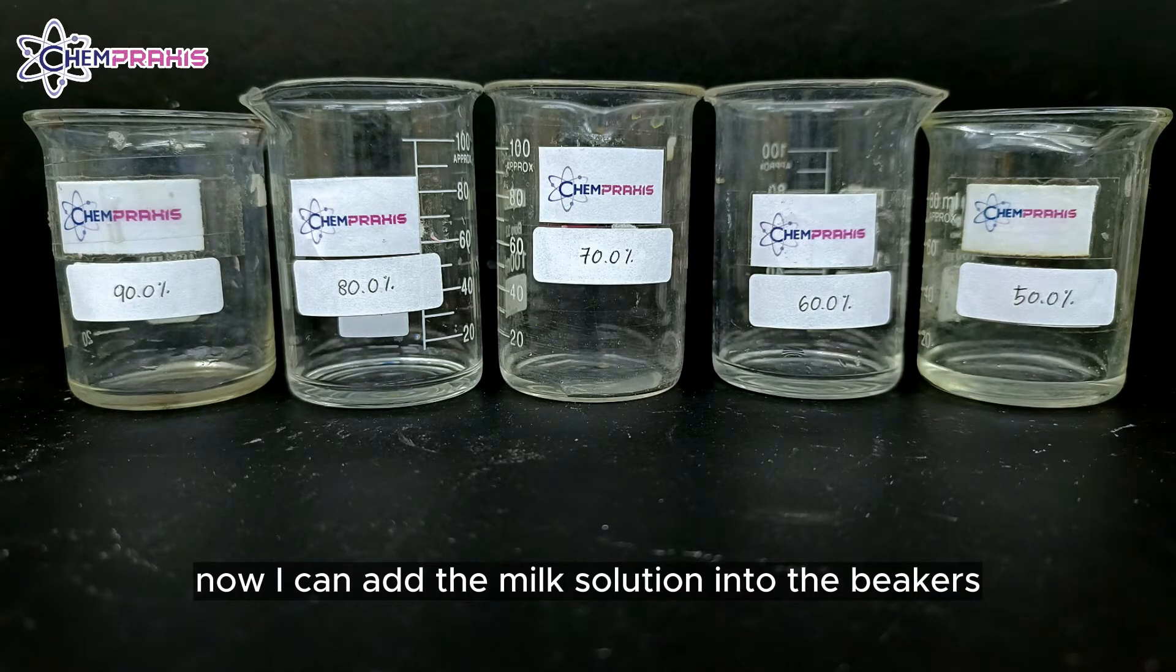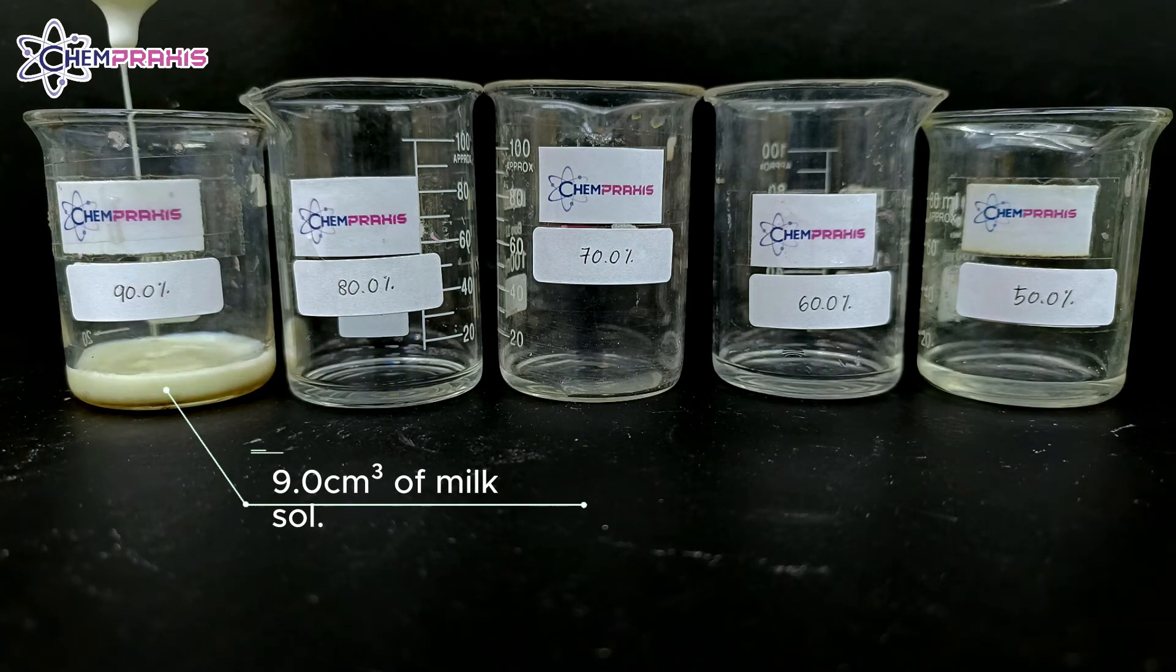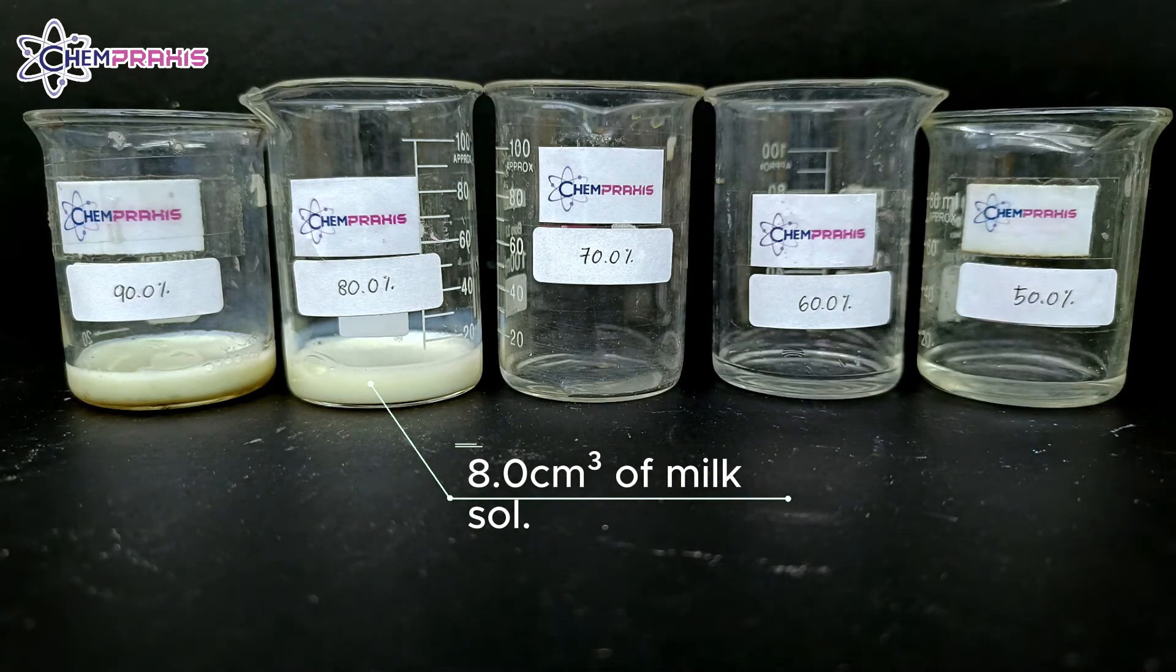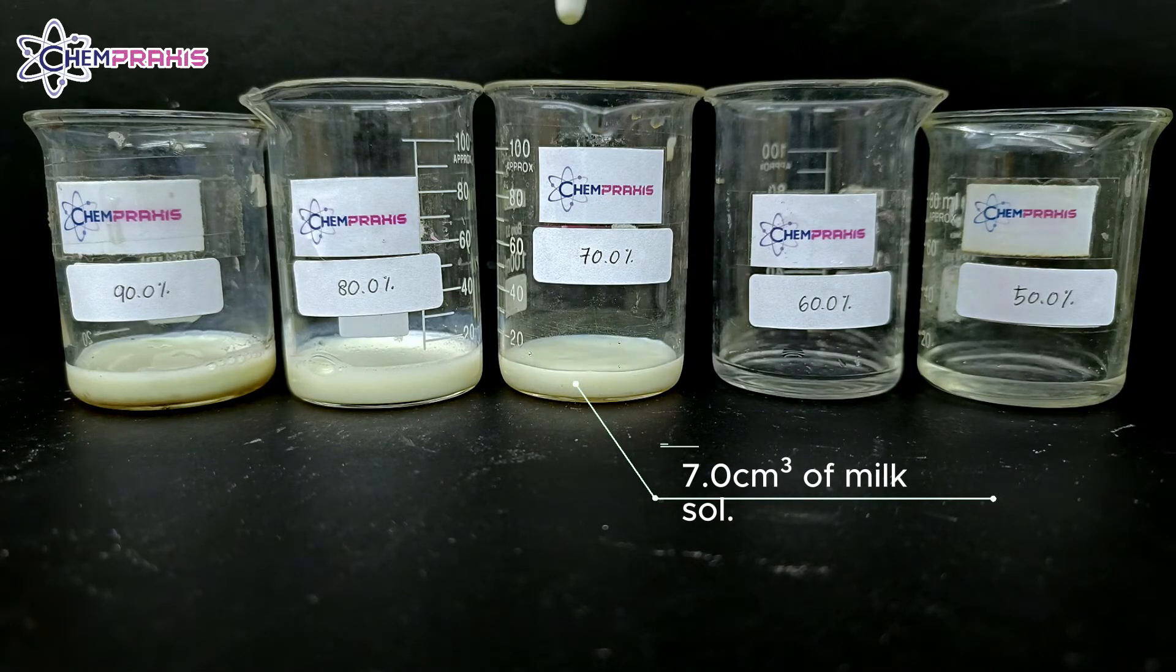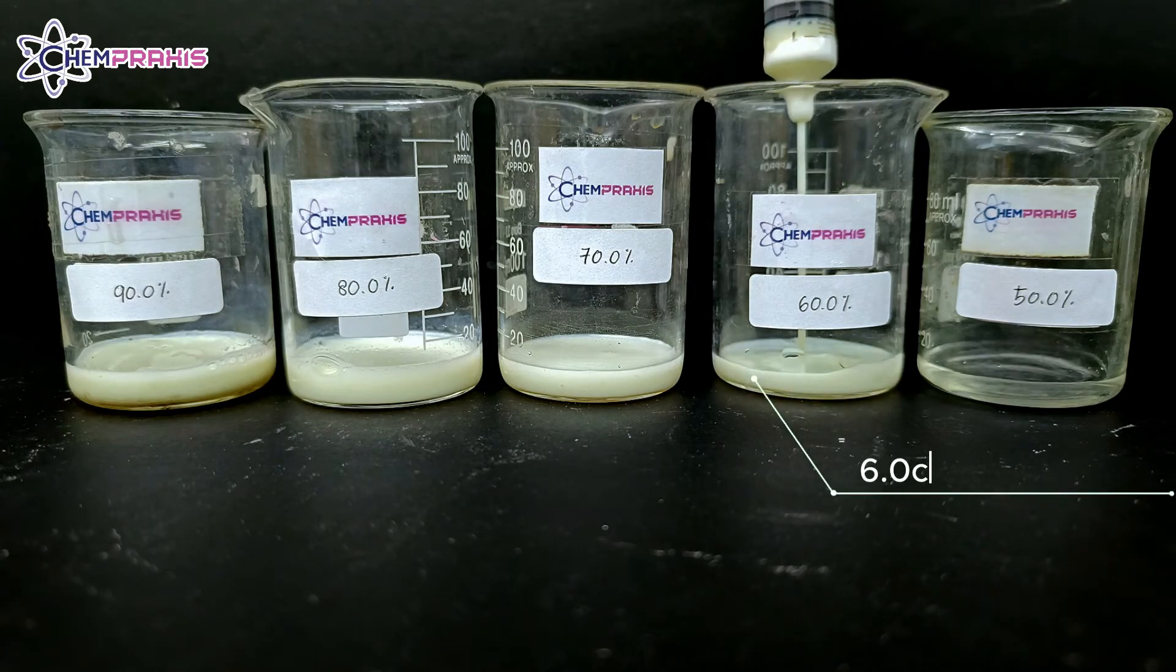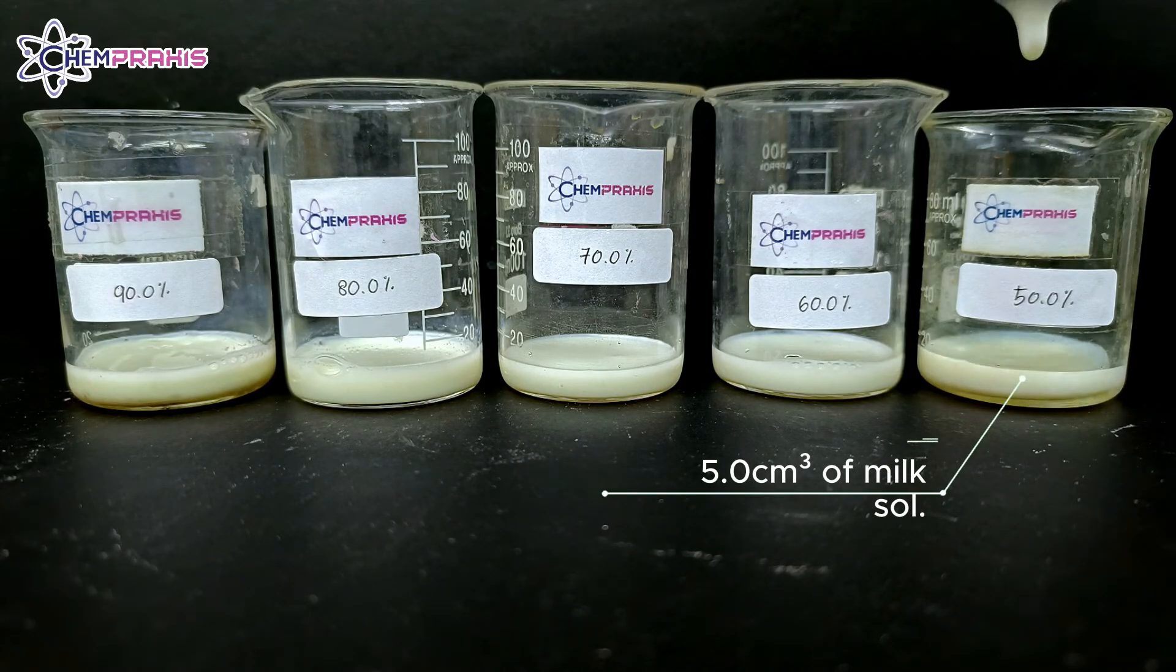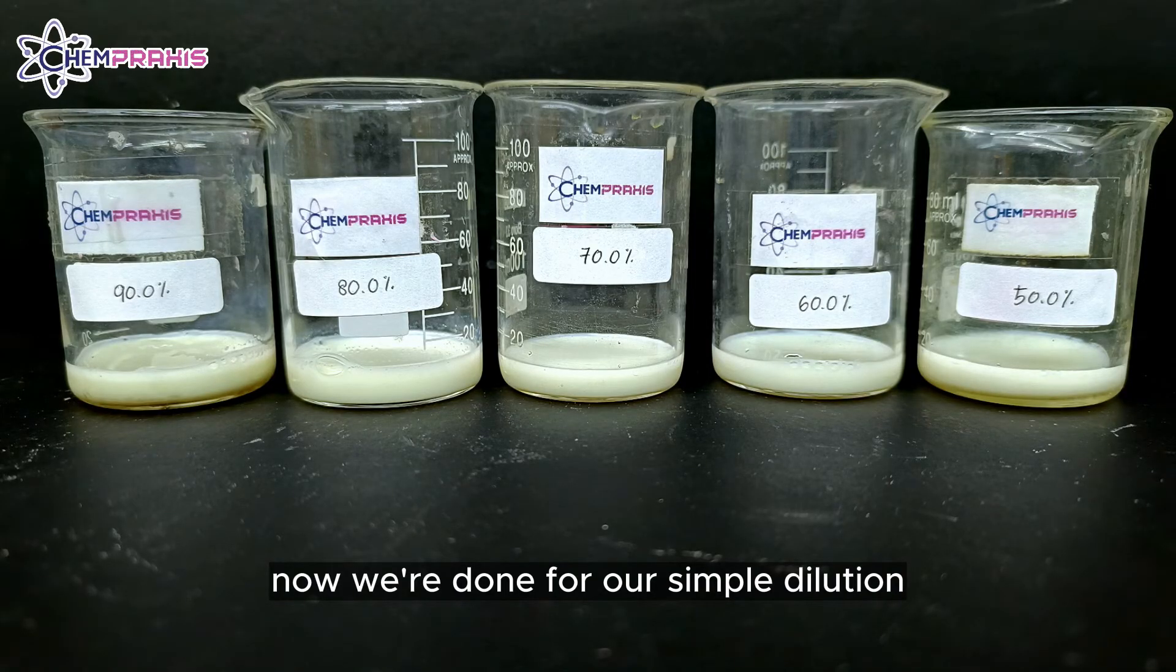Now I can add the milk solution into the beakers. Now we're done with our simple dilution.